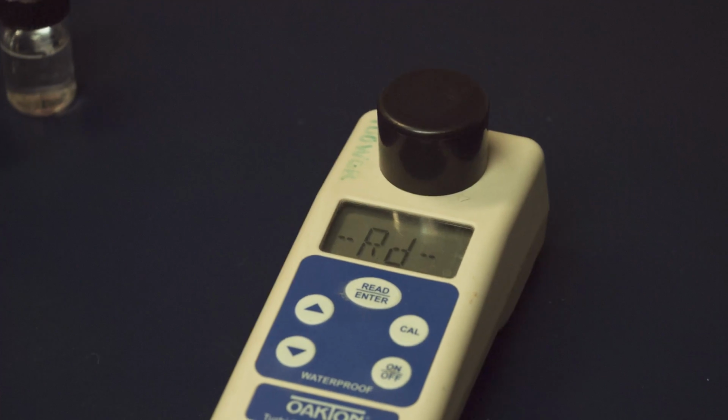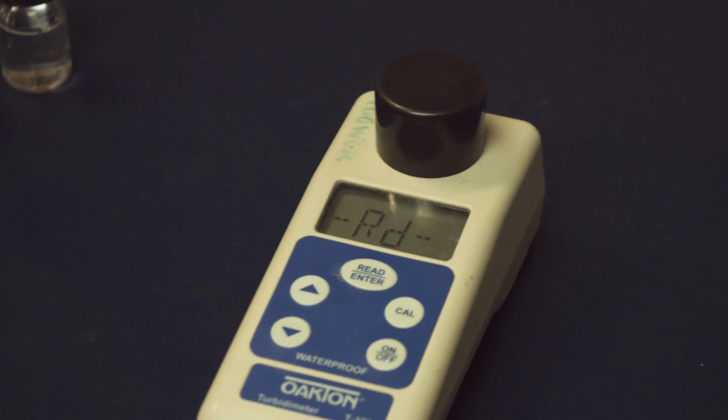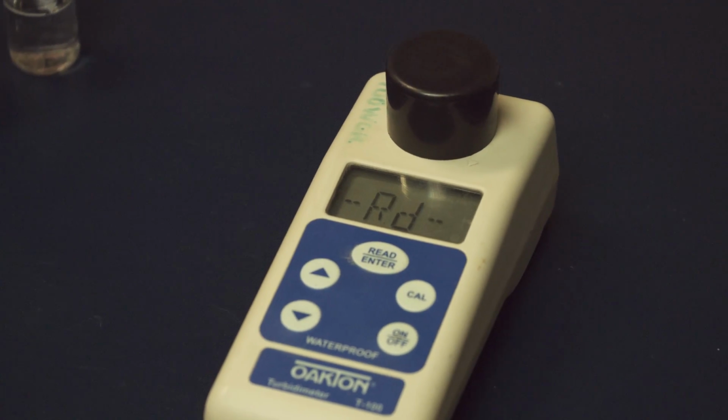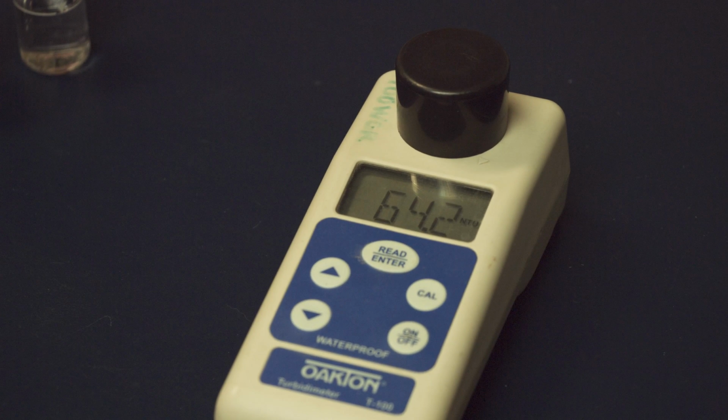Our goal here was to see if the problem was an equipment limitation or if we had a suspension that looked more turbid than it actually was. Would you believe that our meters read this sample at 64.2? We wouldn't have believed it either until it happened.